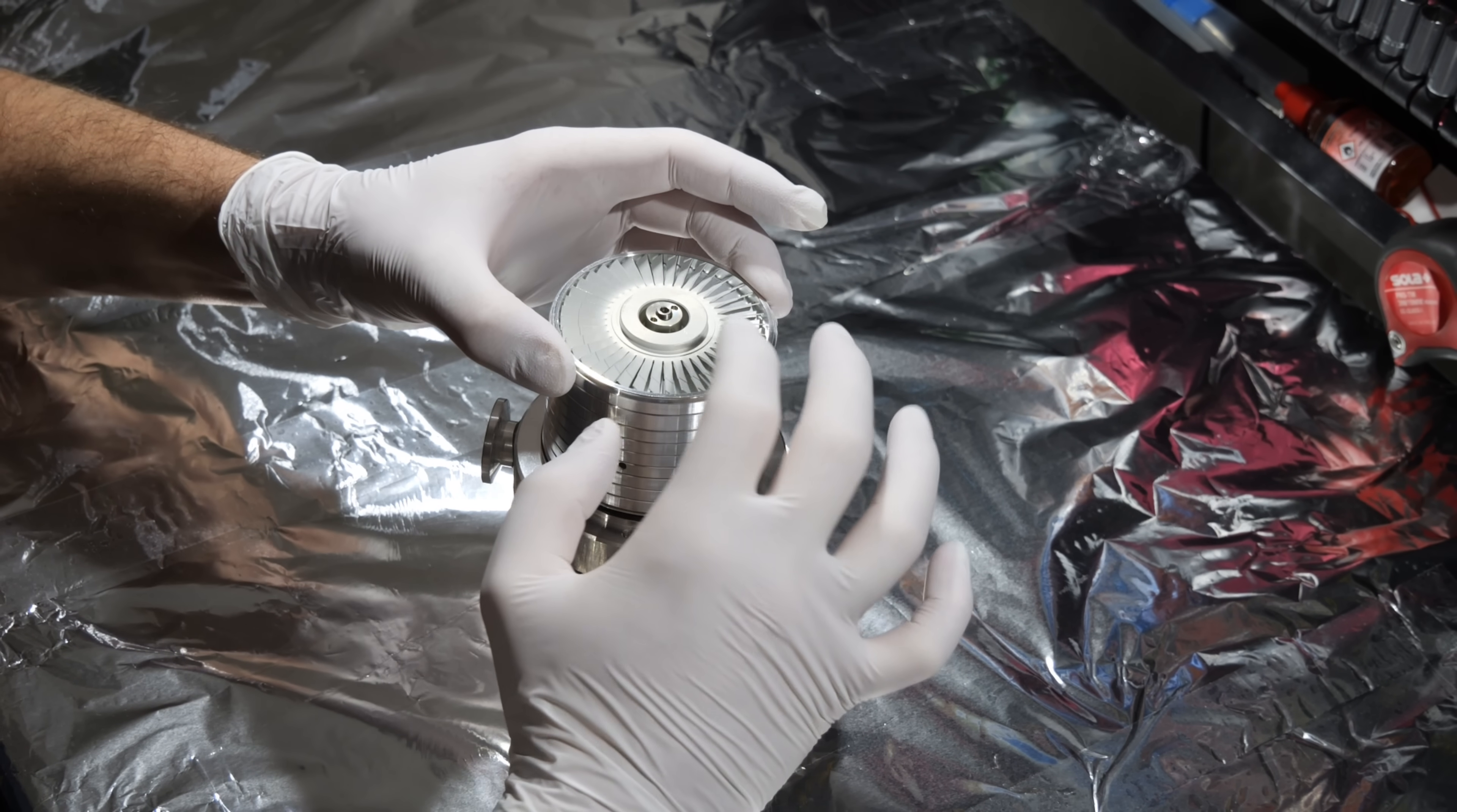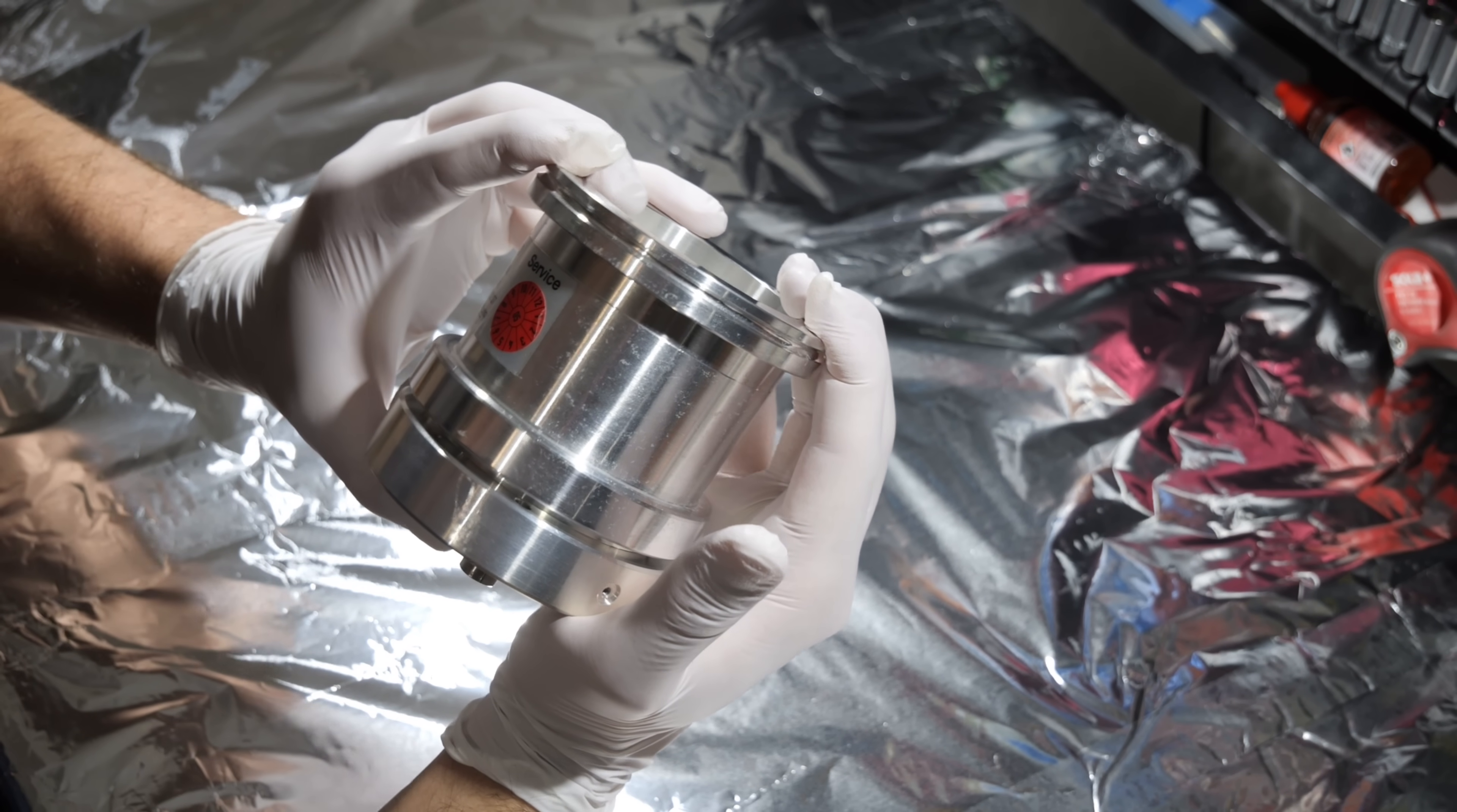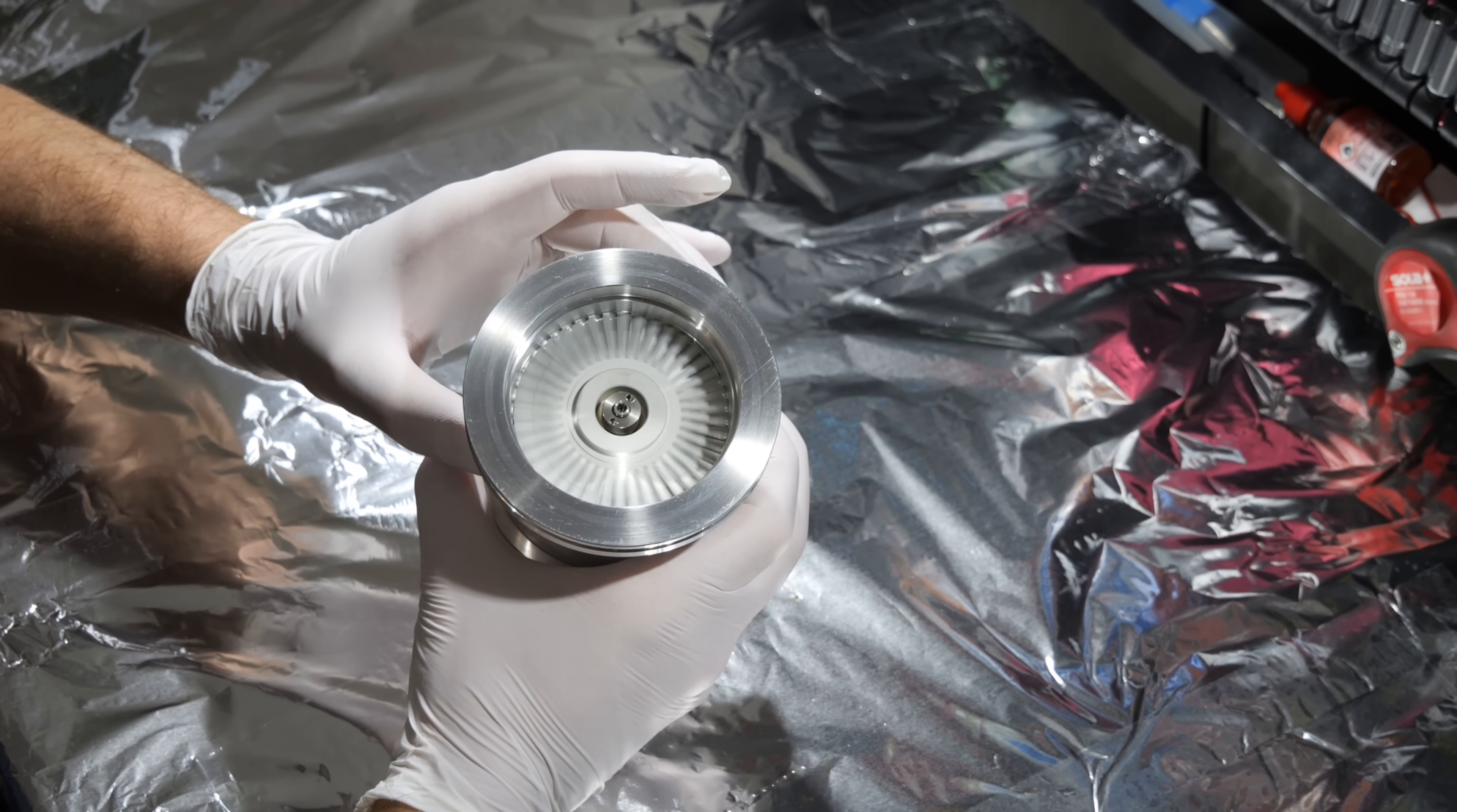And now push on the top stator. Yeah, perfect. Yeah, and it still spins. Great.